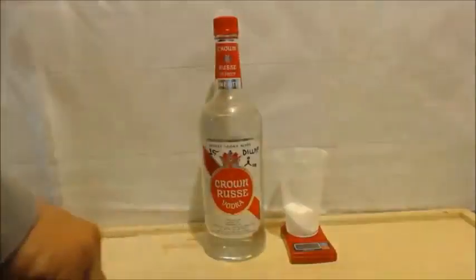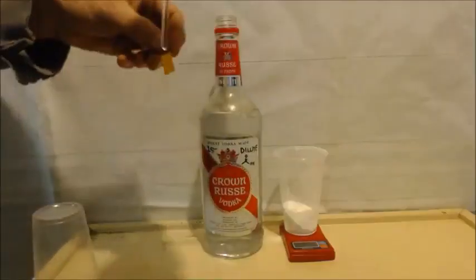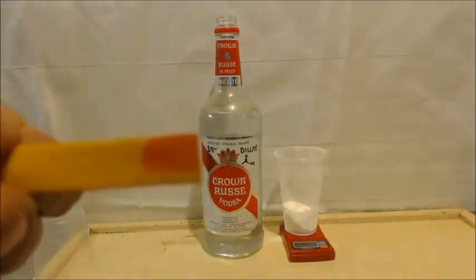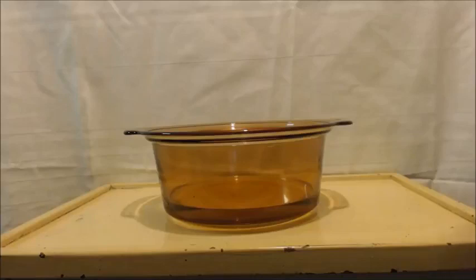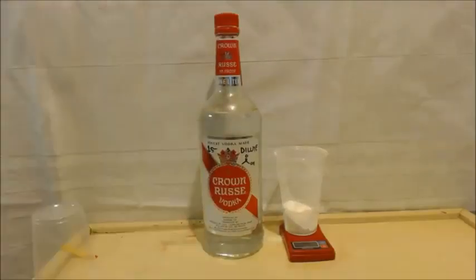Okay, I want to just do a little pH test. So you can see it's acidic. The pH was a 2. There's barely anything in there. I mean, that's like a 3%. I mean, you can get vinegar for, I think it's 5%, I'm not sure, at the grocery store. So I'm going to set up, and I'll show you in a second here.